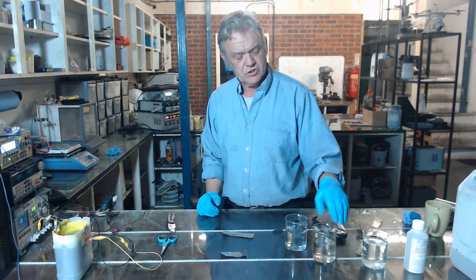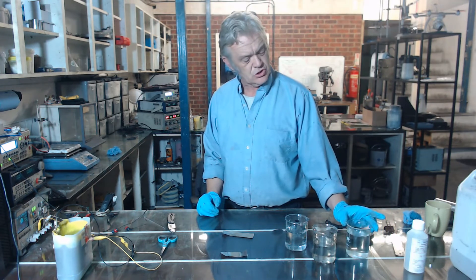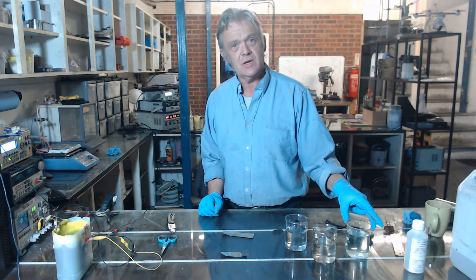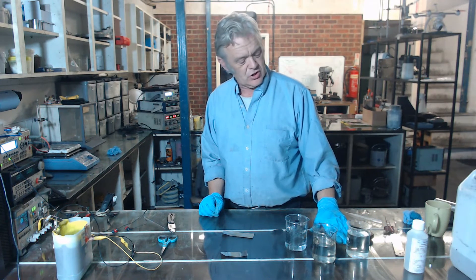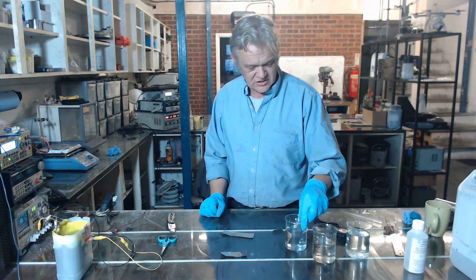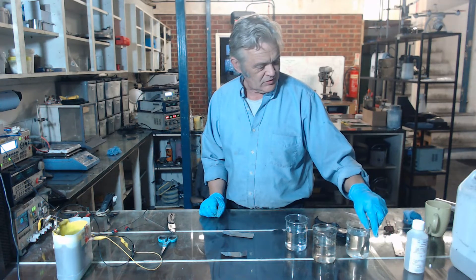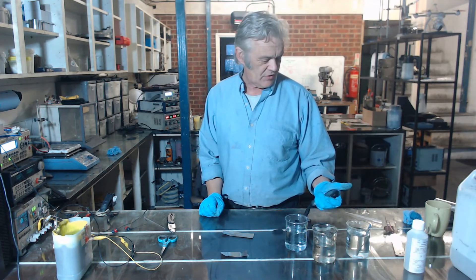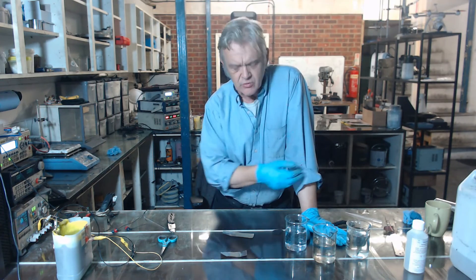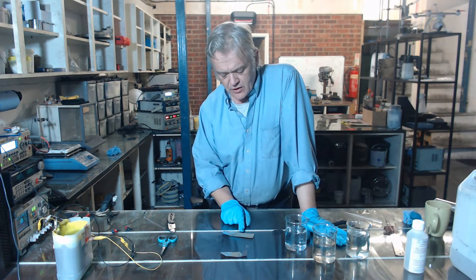Now we're going to wash it in water and then put it in the passivation chemical. That's a mixture of 5% acetic acid — which is vinegar — and sodium molybdate. It's a 0.1 molar solution of sodium molybdate, originally 100 mL then made up to 200 mL with 5% acetic acid, or just ordinary vinegar. It's had its 30 seconds, so let's give that a wash in water and then pop it into the molybdate passivation bath. That will take about 20 to 30 minutes — just leave it sitting and it'll turn into a nice golden colour. Once that golden colour has appeared, you can do other things with it.